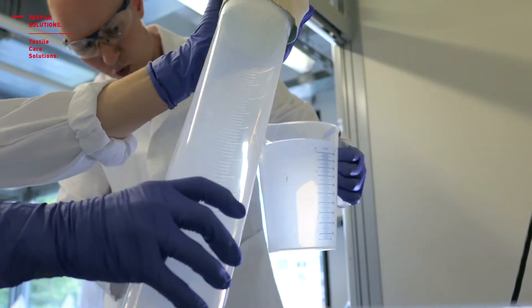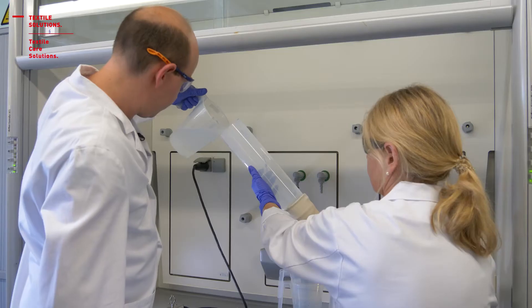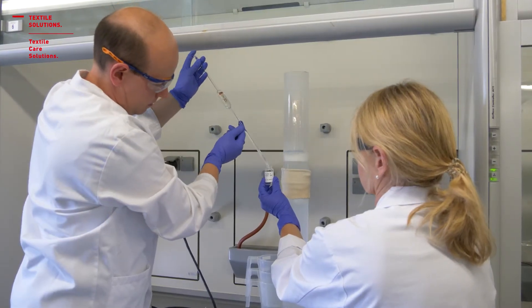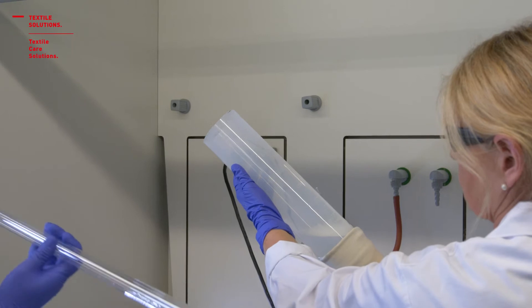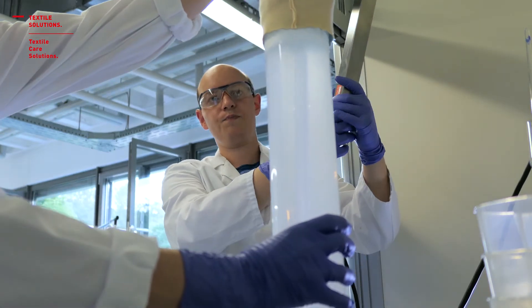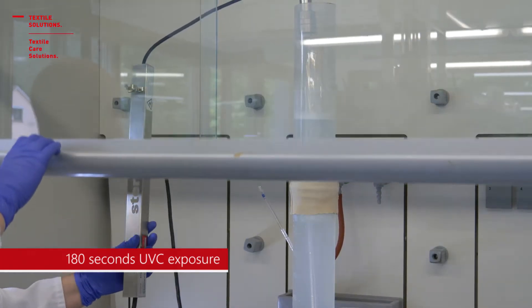We prepared a complete standard washing recipe based on peroxide. We pour the washing liquor into a cylinder. Then we take a sample out of this wash liquor — that's the sample without UVC energy. Now we place the UVC tube into the cylinder with the standard wash liquor and expose the standard washing recipe to the UVC energy for 180 seconds.